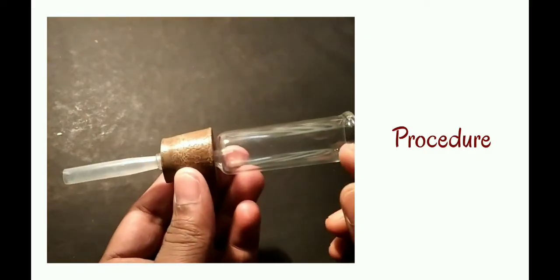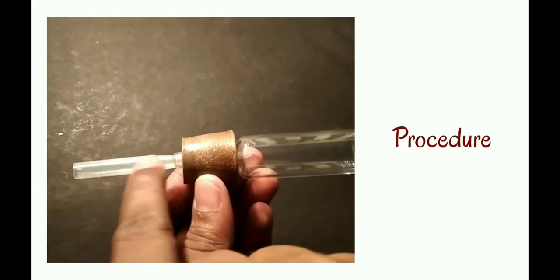After the assembly, you can see the upper portion is the water tube, cork, and the bubbler.